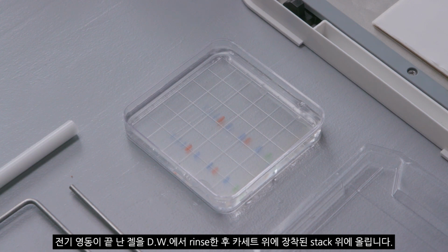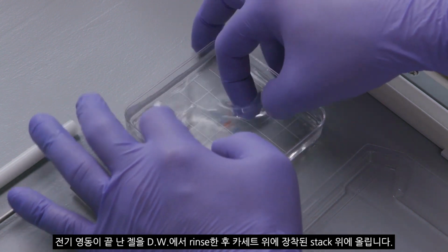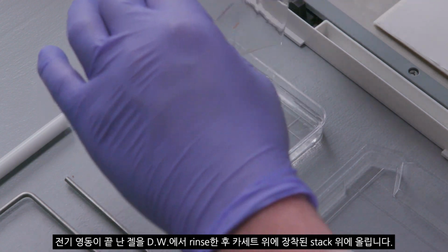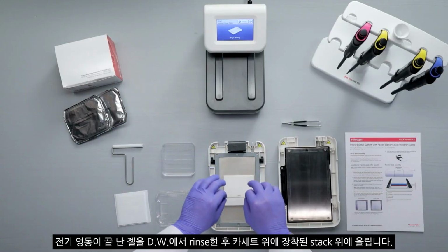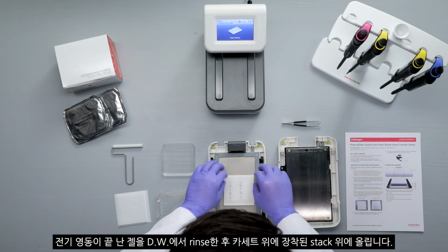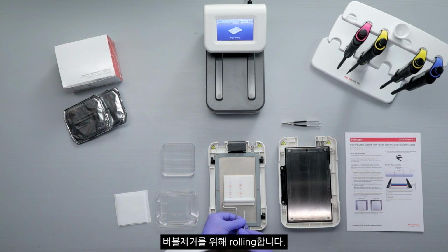Open the gel cassette and immerse the pre-run gel briefly in deionized water for 5 to 15 seconds. Gently shake off any excess water, then place the pre-run gel on the transfer membrane of the bottom anode stack. Trim the gel carefully so that no parts of the gel hang over the sides of the stack. Use the roller to remove any air bubbles from between the gel and the membrane.